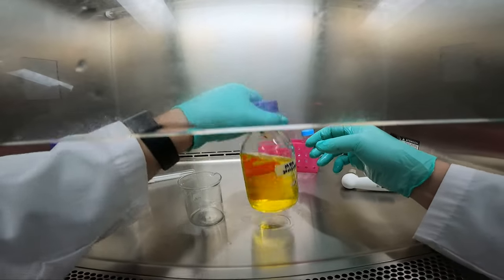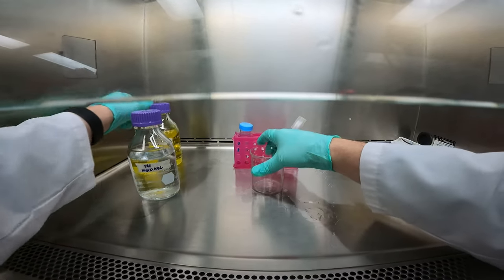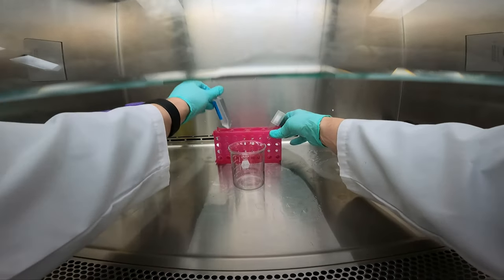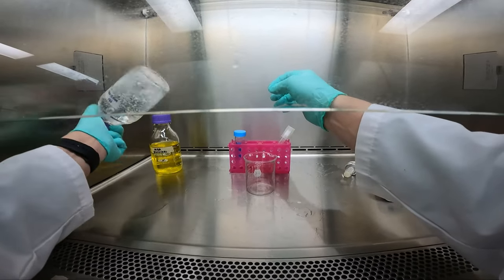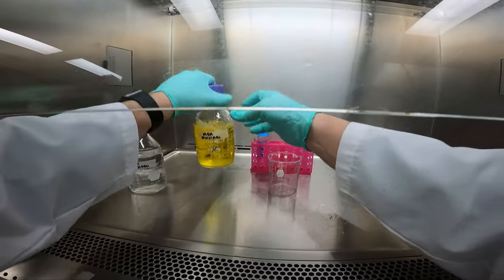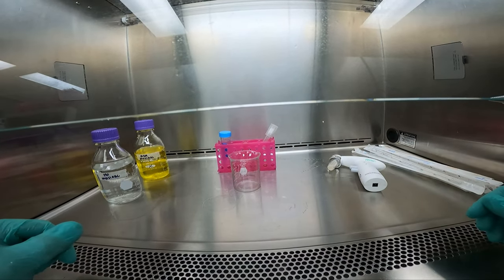Spray down our hands before we go inside and we'll organize the hood. I like my solutions on the left and my pipettes on the right. If you're left-handed, I'd advise you to do the mirror image of what I'm doing. I would mix my solutions first and loosen my caps so they can be easily opened with a single hand. If I was subculturing, I would use PBS first, then trypsin, then MEM — so I'll place them in that order to help ensure I use the right chemical at the right time.